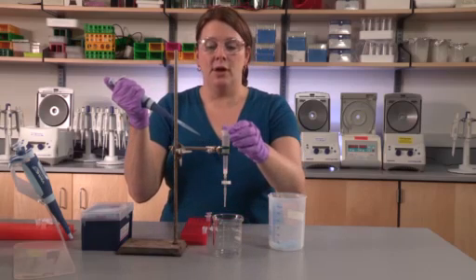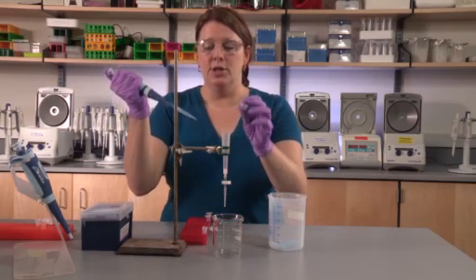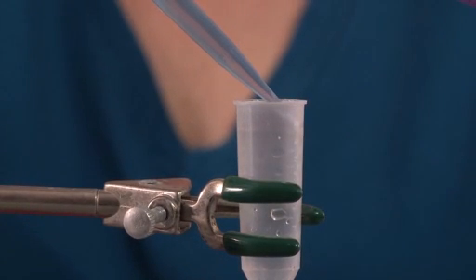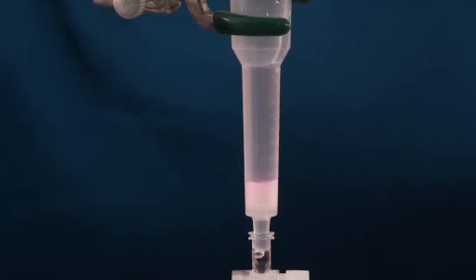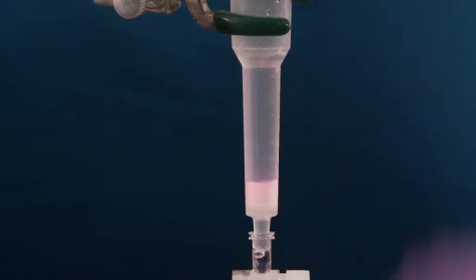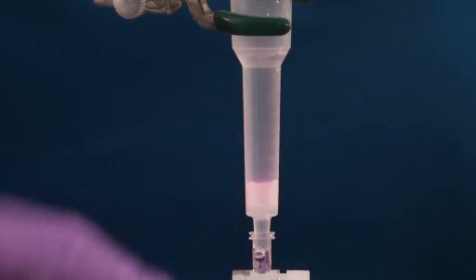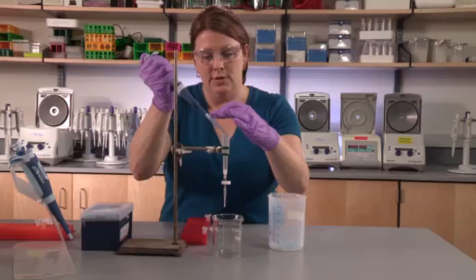Open the cap of the column and remember to slowly dispense the elution buffer at an angle, allowing it to gently drip down the side of the column. Do not disrupt the resin and keep the surface of it flat.